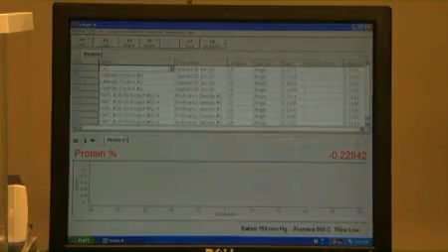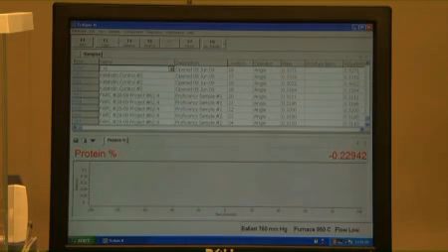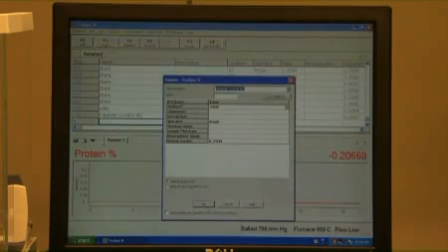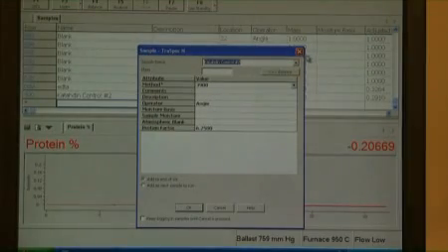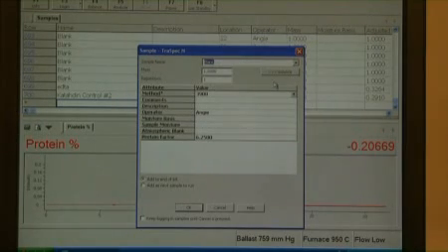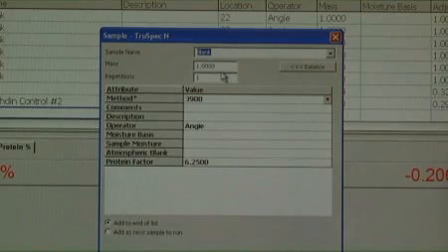Before a blank is analyzed, a sample labeled blank must be entered into the spreadsheet. This procedure is called blank login. From the Samples menu, select Login. The Sample Login dialog box will appear. Click the drop-down arrow in the Sample Name selection box and select Blank from the list. Leave the default value in the mass box at 1.000.